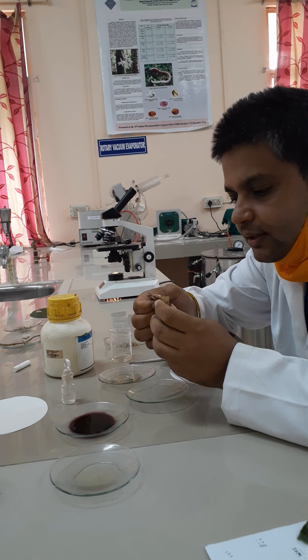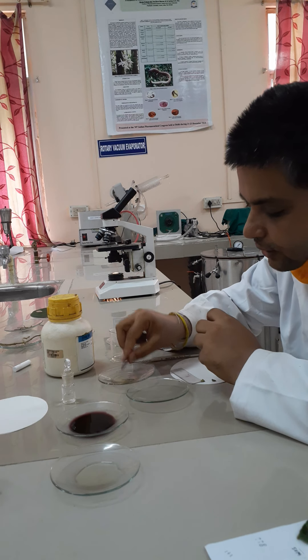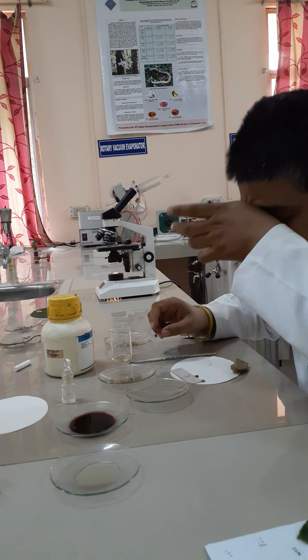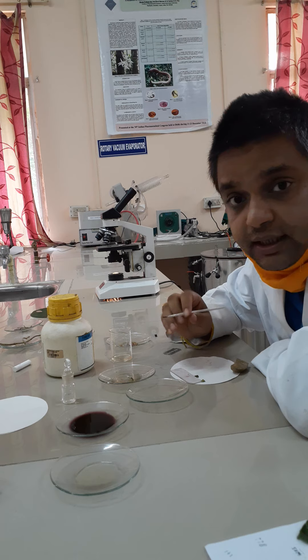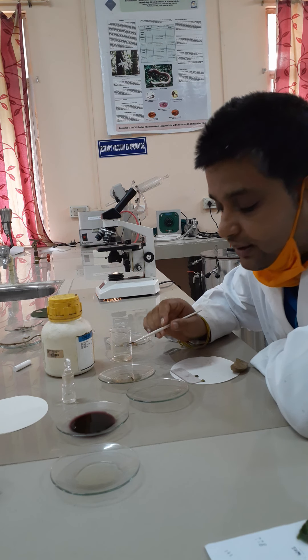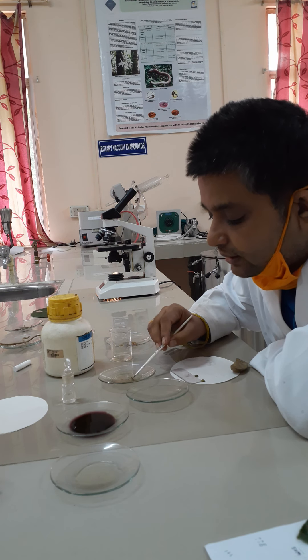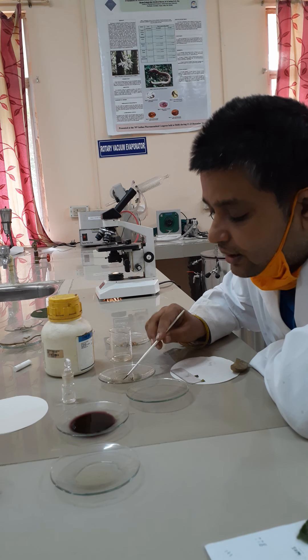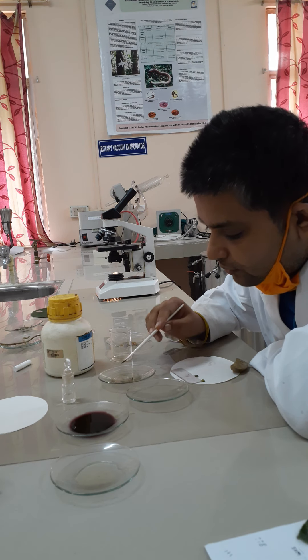You will find so many sections; take as many as possible. As I mentioned, lighter the color, thinner the section; darker the color, thicker the section. You have to find the thinnest section and take it out.